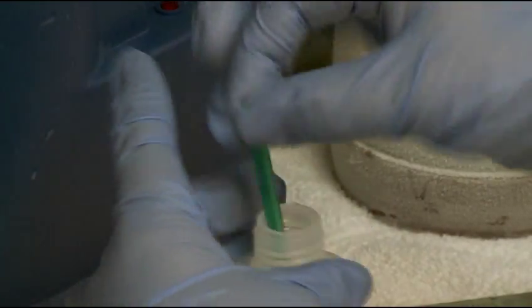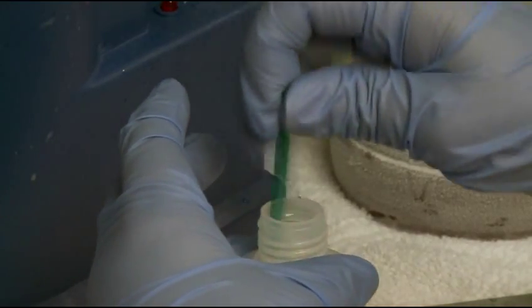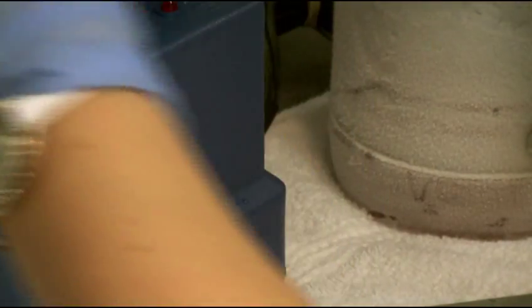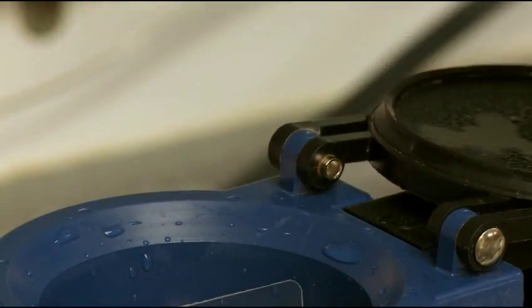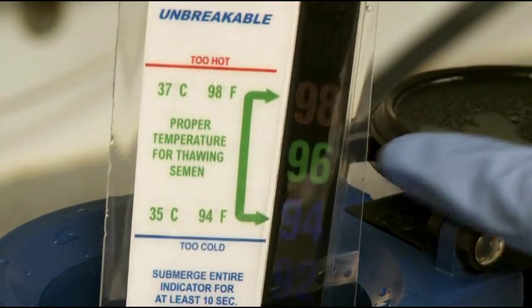Repeat this process to achieve the desired number of viable cells per dose. OSI currently recommends using eight straws to create one dose of semen.